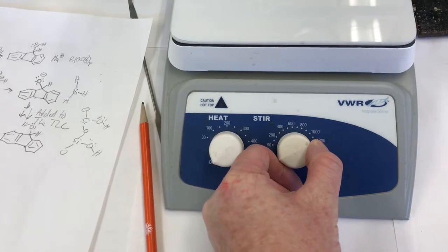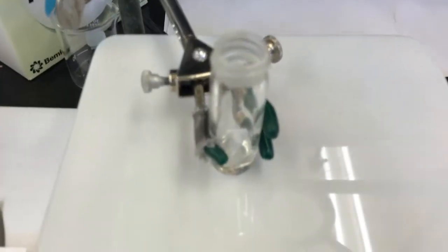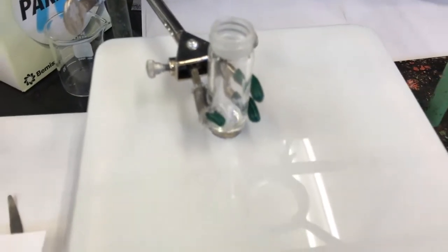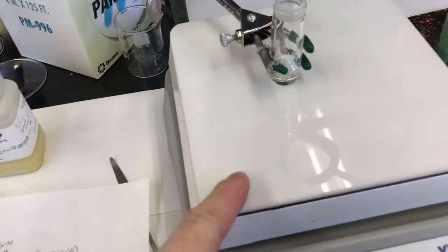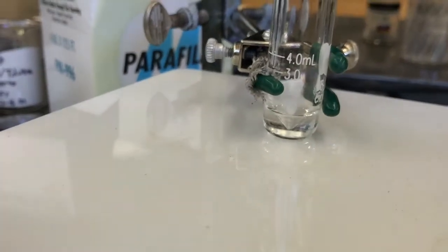When you turn it on, just turn it on like the smallest bit at first and you might not see anything happen. Oh, wait, nope, it just took a little while to get going. It's starting to spin a little bit. Isn't that cool? So what's happening is underneath this, the plate of the hot plate, which isn't being heated now, there's a magnet. Let's see if we can see it, and it's spinning. See, oh yeah, there it is. So you can barely see it. There's a magnet under there spinning. And since that magnet's spinning, the magnetic stir bar will spin too. And that'll stir our solution for us.